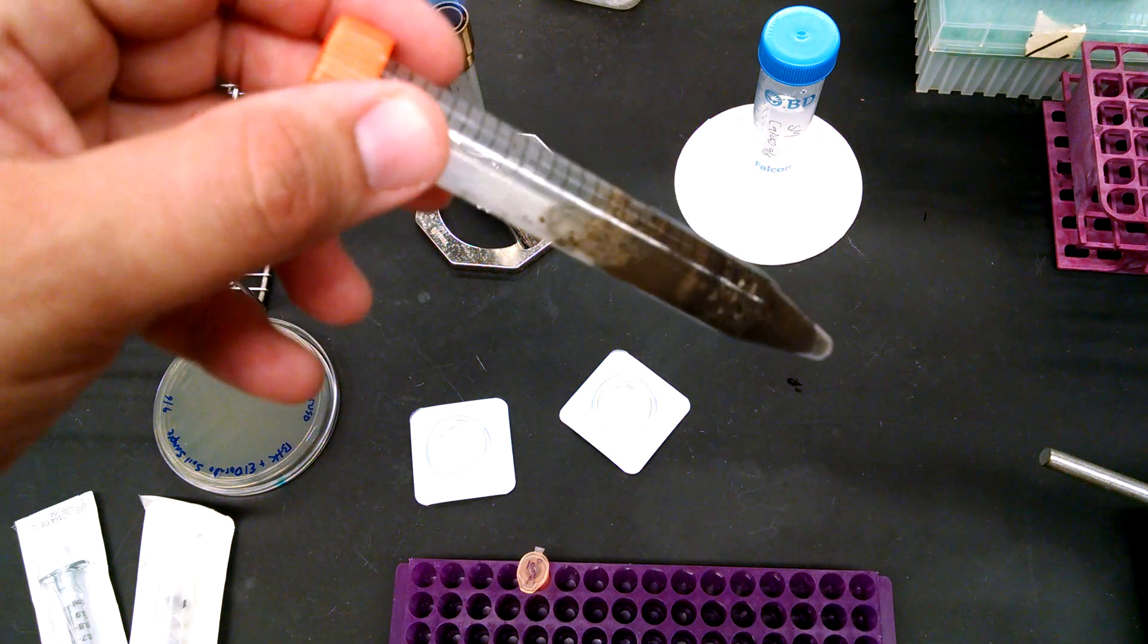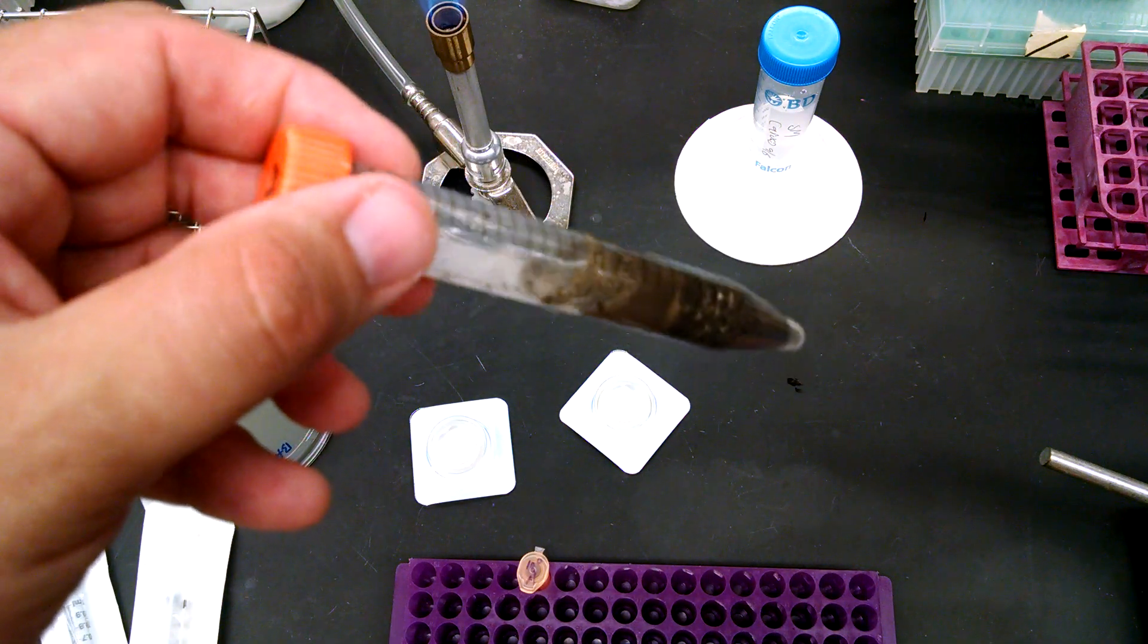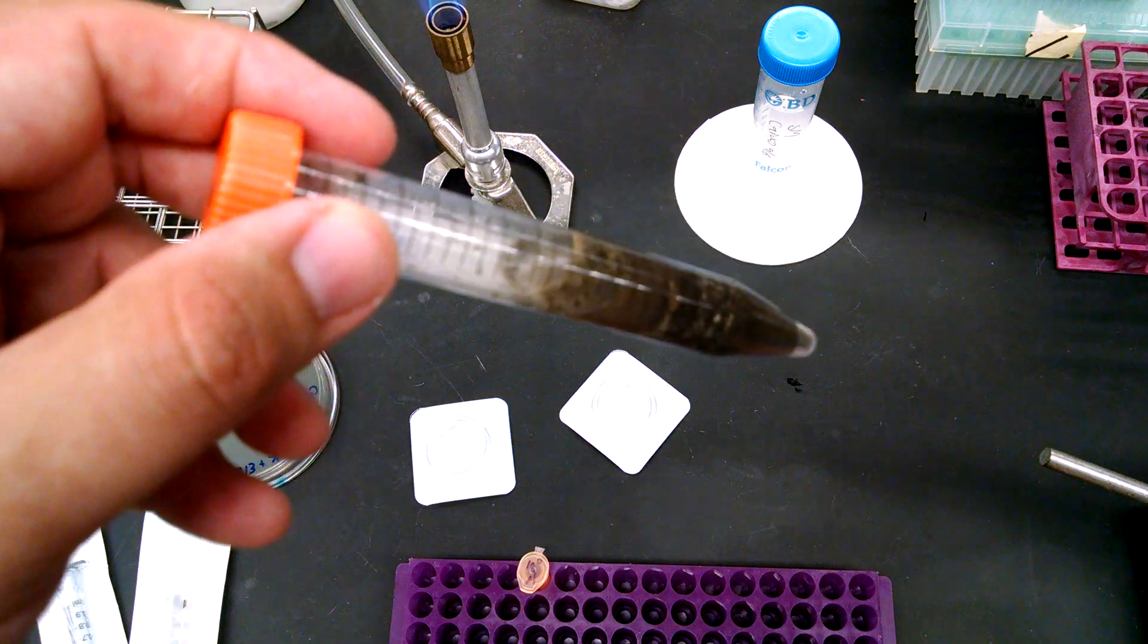But we need to get any bacteria and fungus and dirt and all that out of that, and that's what we're going to use these filters to filter sterilize it for.